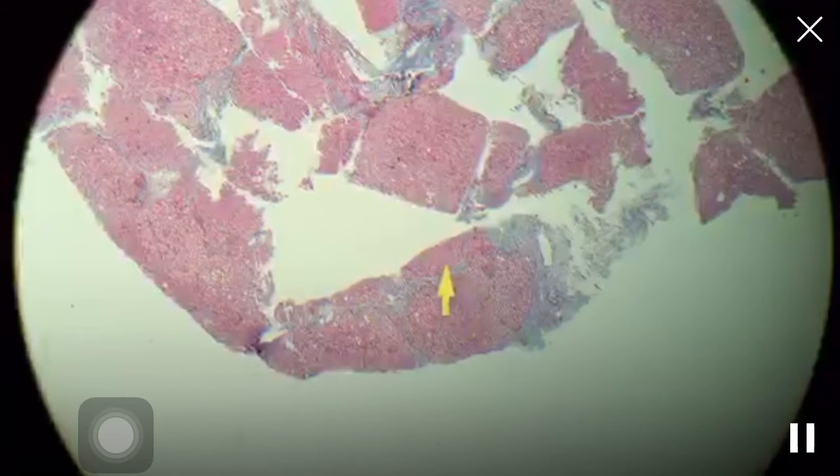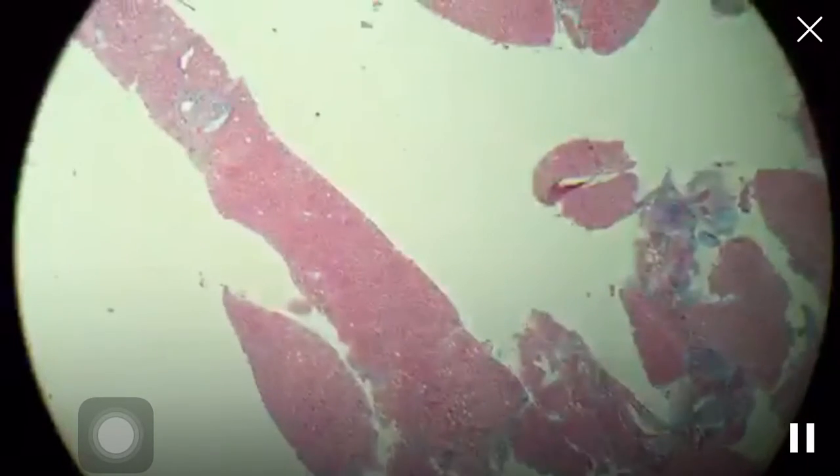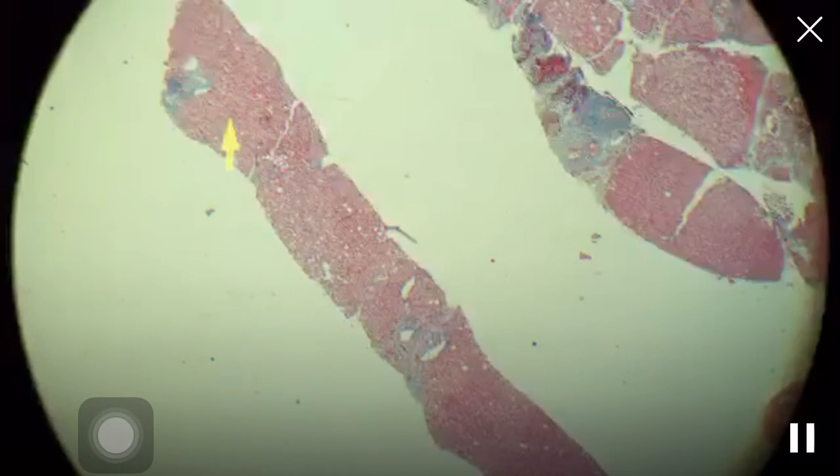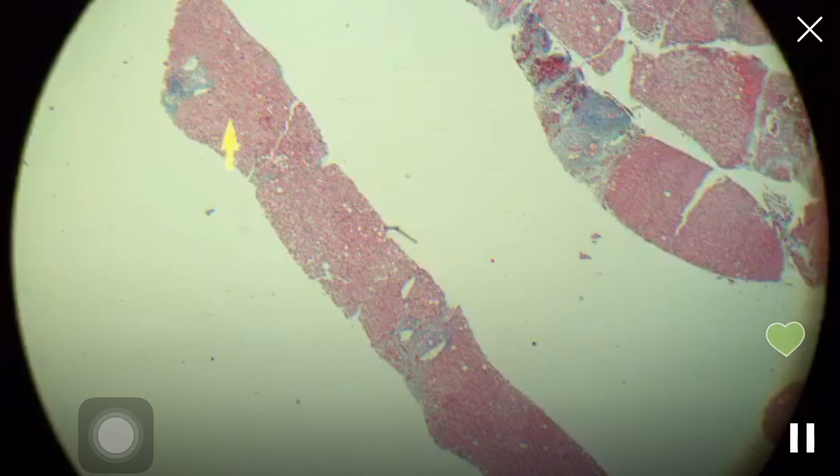Here, this area looks clearly cirrhotic. This area, not so clearly cirrhotic. So to me, that's what I call transition to cirrhosis. And again, there are formal grading and staging schemes that will tell you how to describe this. Those, according to their authors, are for research. So I will simply describe this as best as I can.